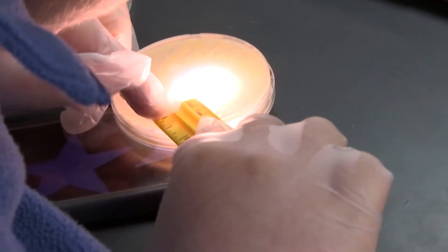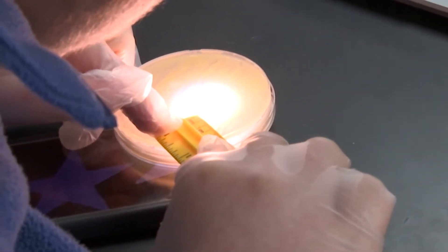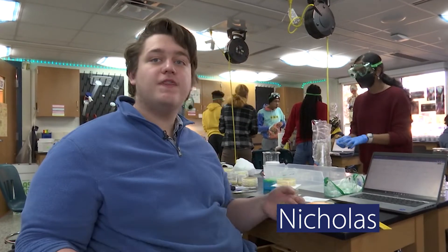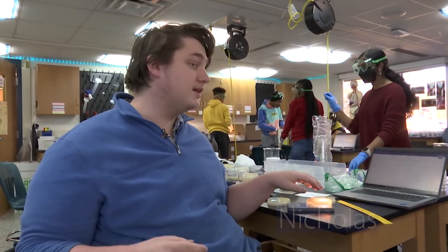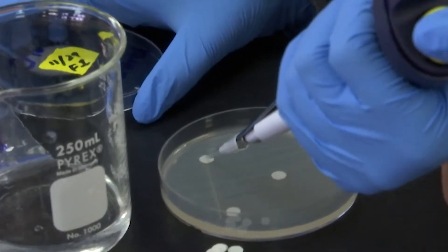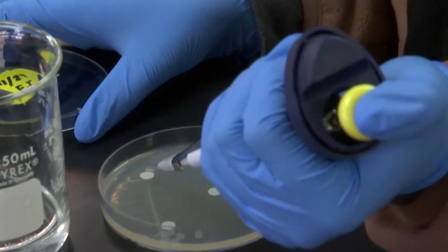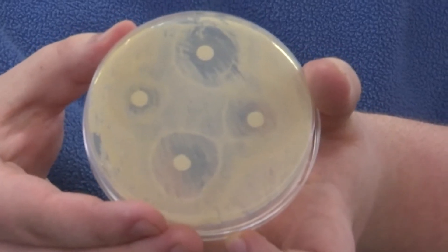I'm a beekeeper, so what I'm doing is using my own honey to do a zone of inhibition test. What that means is we put bacteria on the petri dish — this is bacteria from skin. We're using different levels of honey concentration, then we heat it up in the oven and we want to see if the honey mixture kills bacteria.